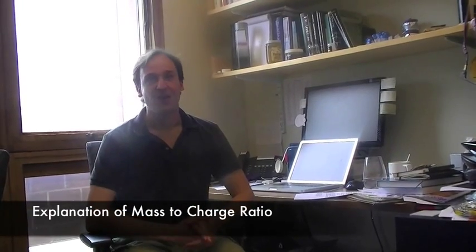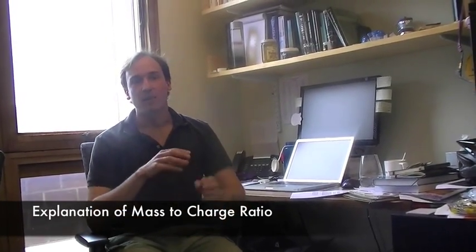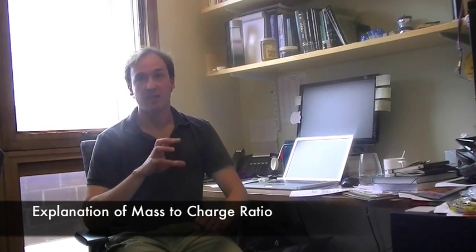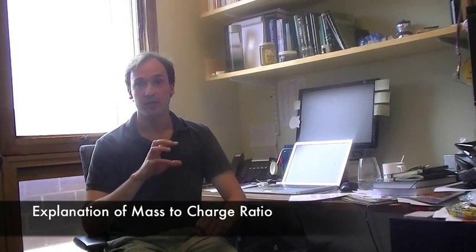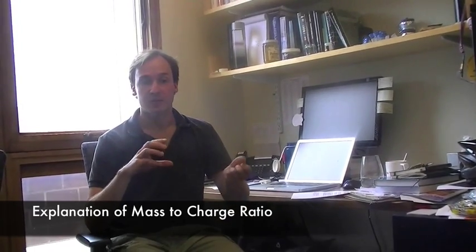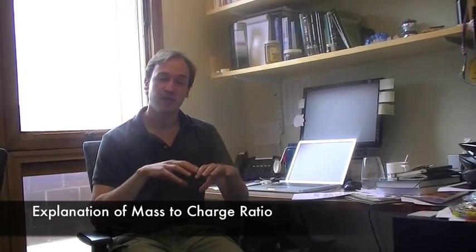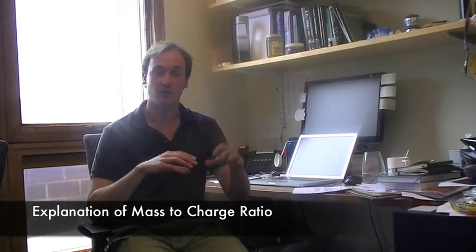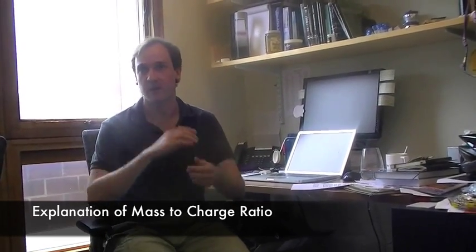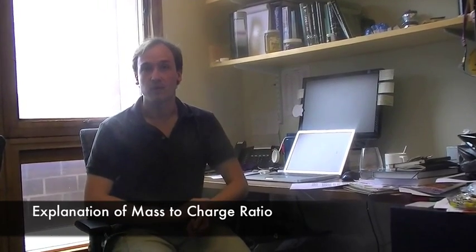Most mass spectrometers operate in a way that at any given moment only ions of a specific mass-to-charge ratio hit the detector. What the mass spectrometer does is change the mass-to-charge ratio it looks for continuously, cycling through that so that we can analyze a lot of these compounds.